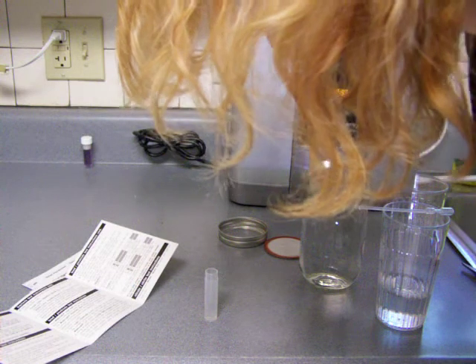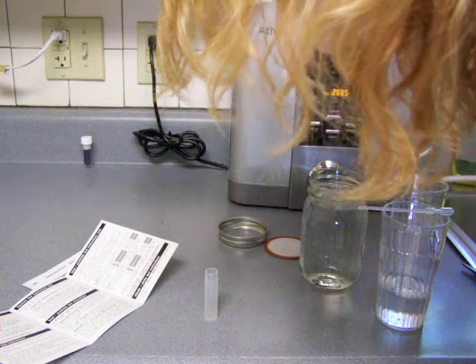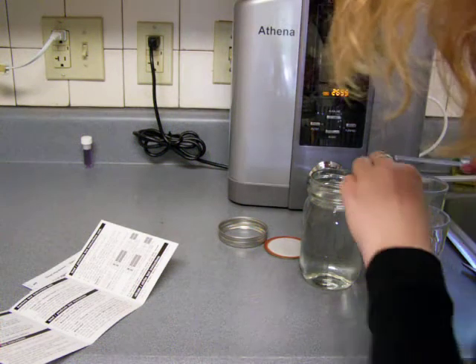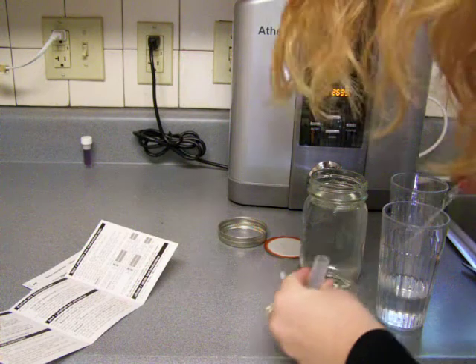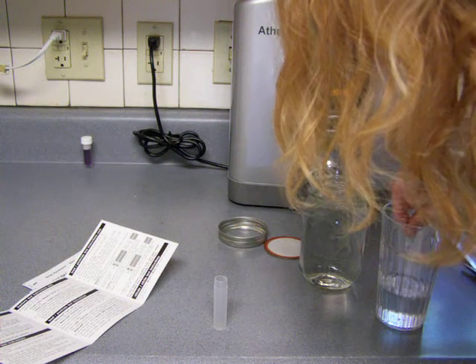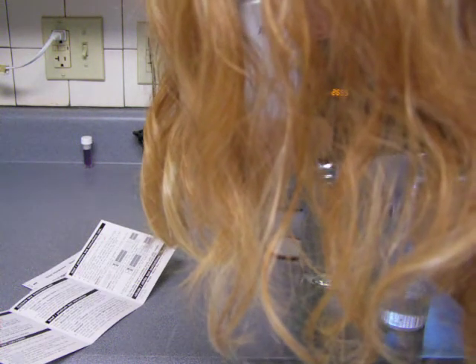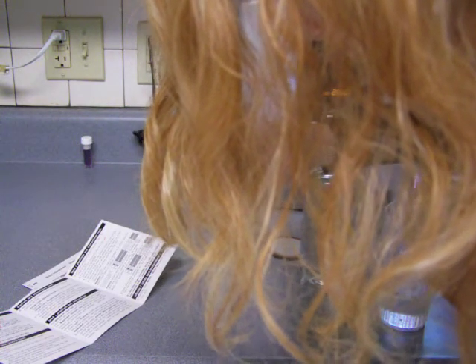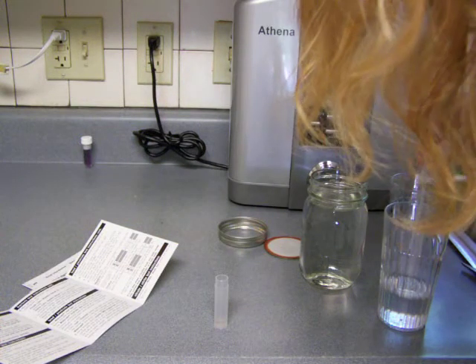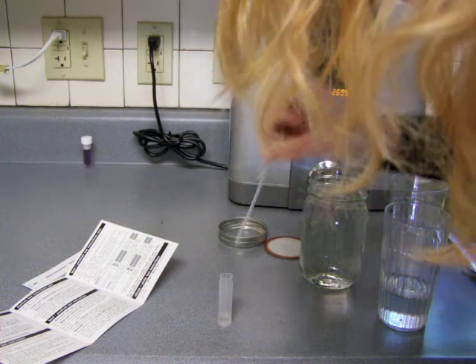To pick up sample, tightly squeeze the bulb at the end of the dropper and place the open end into water sample. Oh, I didn't do it right, I don't think. Okay, so now I think I'm doing it right. It's a little bit more water.